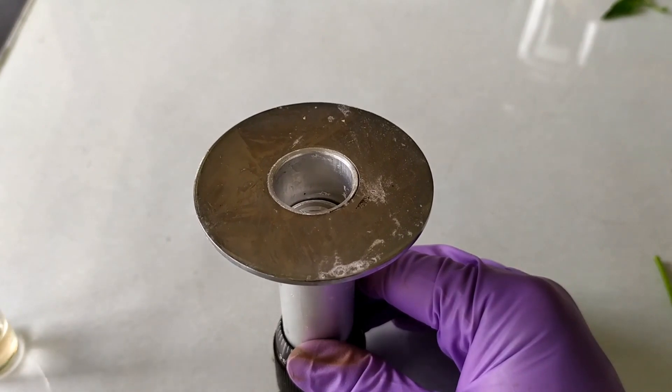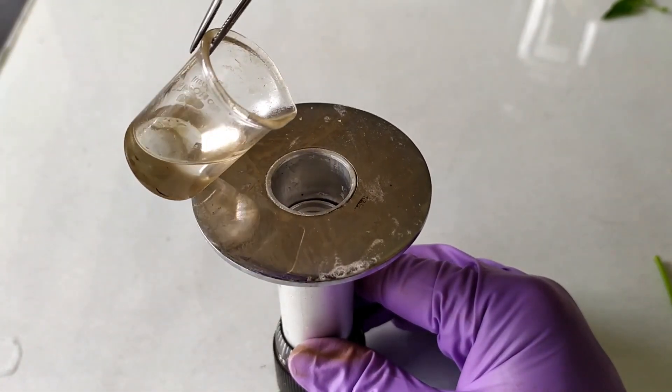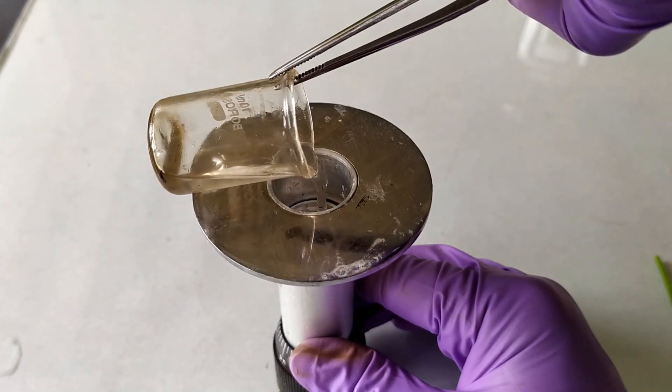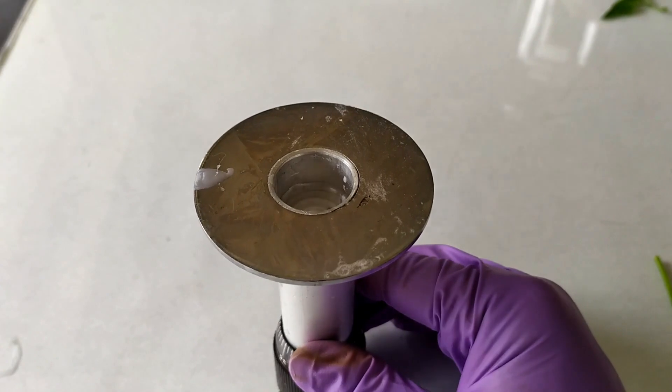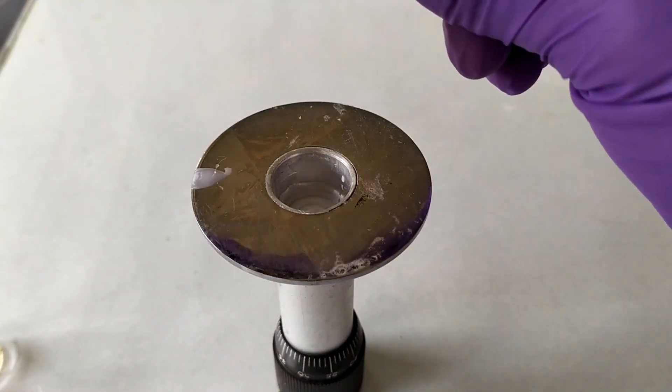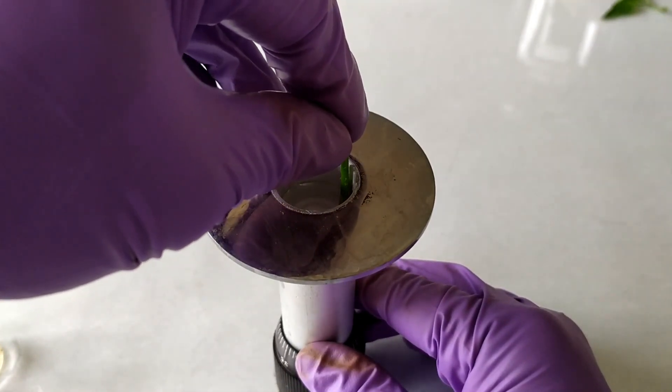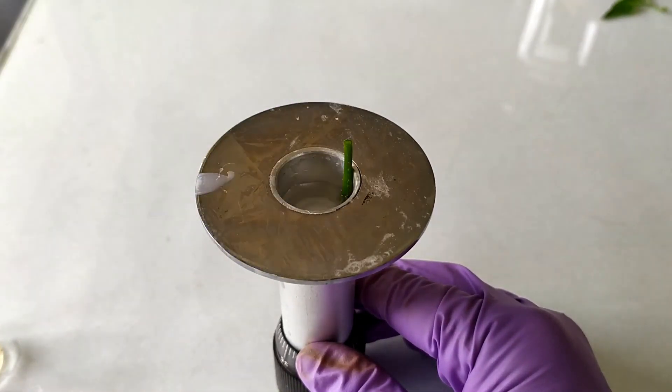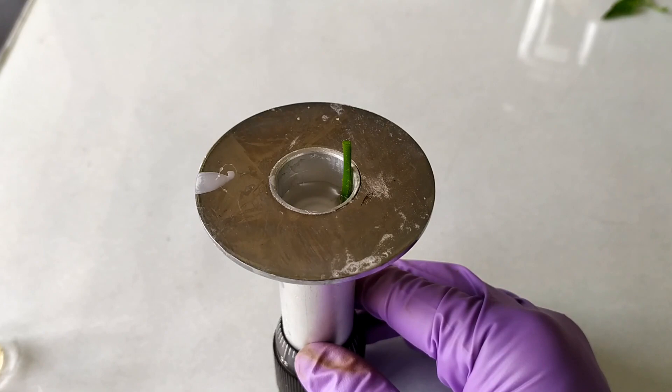If the material is of rigid and elongated form such as a plant stem, there is yet another way of positioning the sample. To do so, first pour molten paraffin wax a few millimeters deep into the sample compartment as shown here. Then immediately place the plant material into the molten paraffin wax such that the specimen rests against the inner wall of the specimen compartment like so. Leave the microtome setup undisturbed to allow the wax to fully solidify.